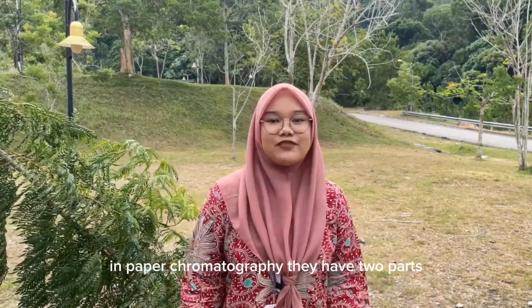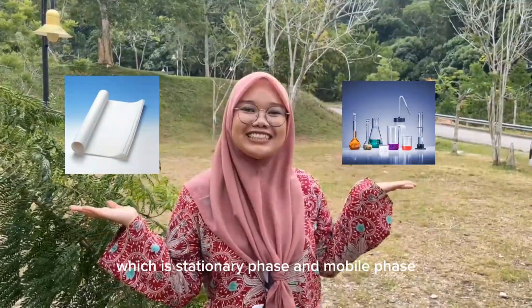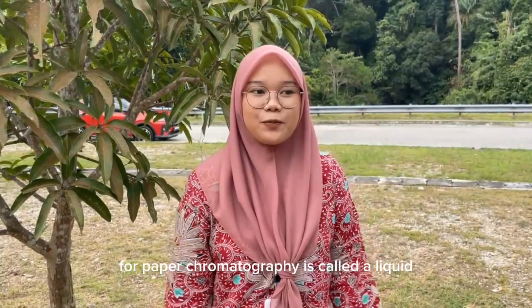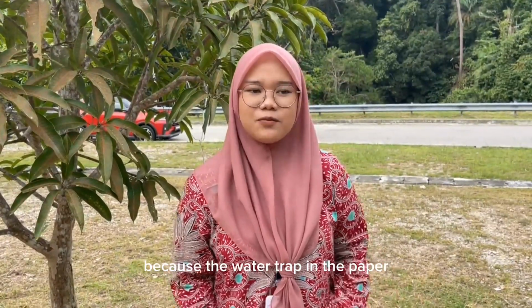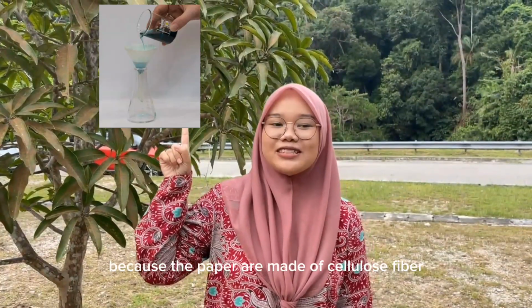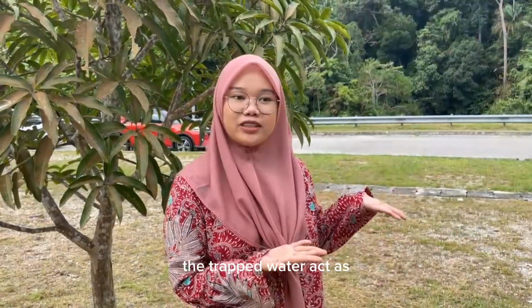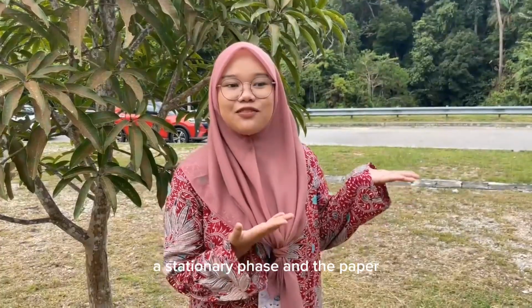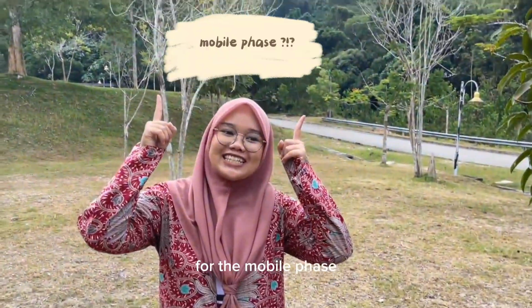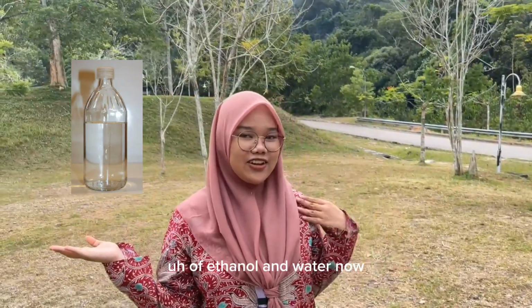In paper chromatography, there are two parts, which are the stationary phase and the mobile phase. First one is the stationary phase. For paper chromatography, it is a liquid, because of the water trapped in the paper, which is made up of cellulose fiber. Filter paper is used because the paper is made of cellulose fiber that contains trapped water molecules. The trapped water acts as the stationary phase and the filter paper itself is the support. For the mobile phase, it is an organic solvent such as a mixture of ethanol and water.